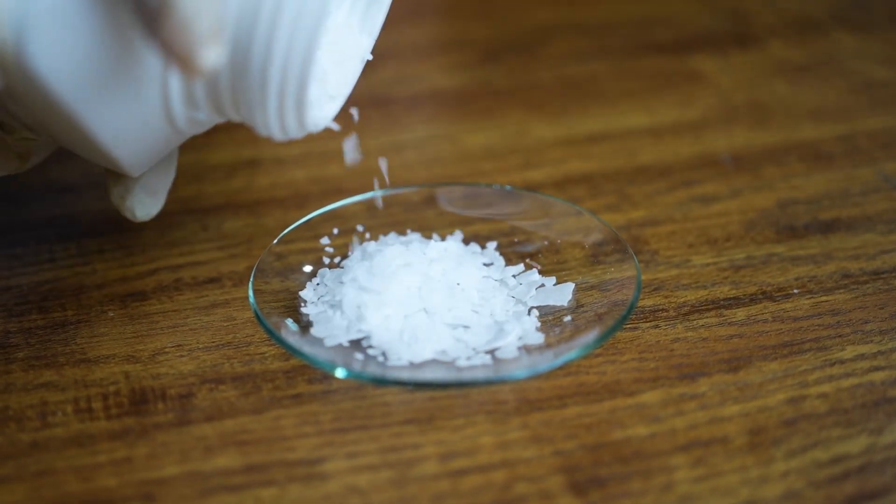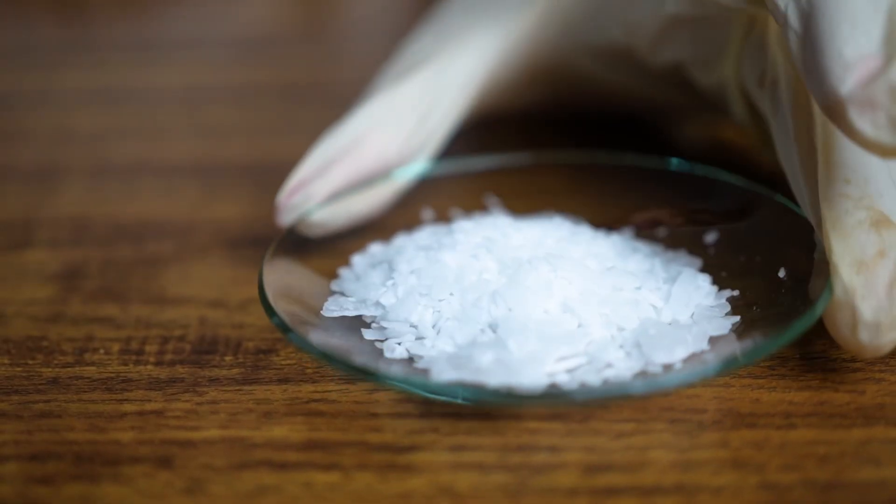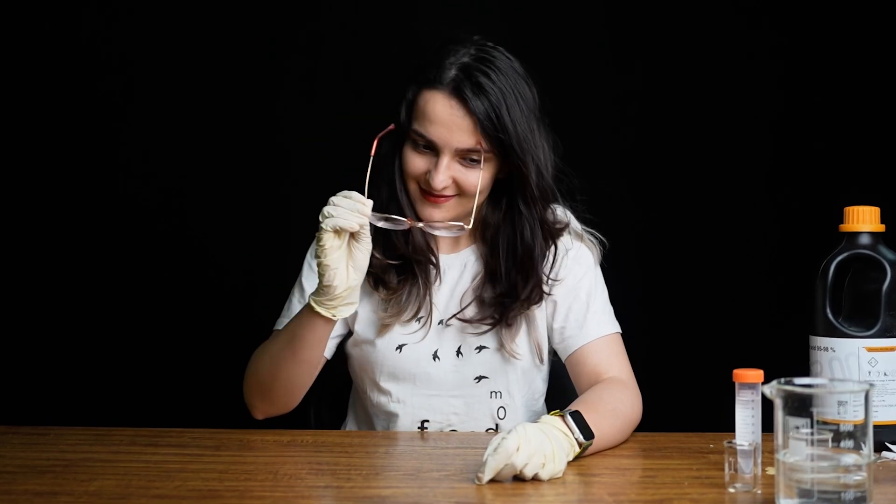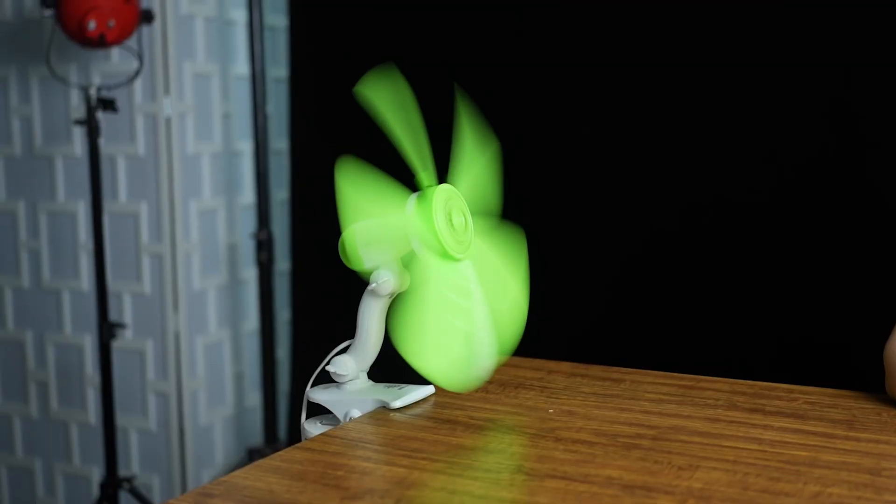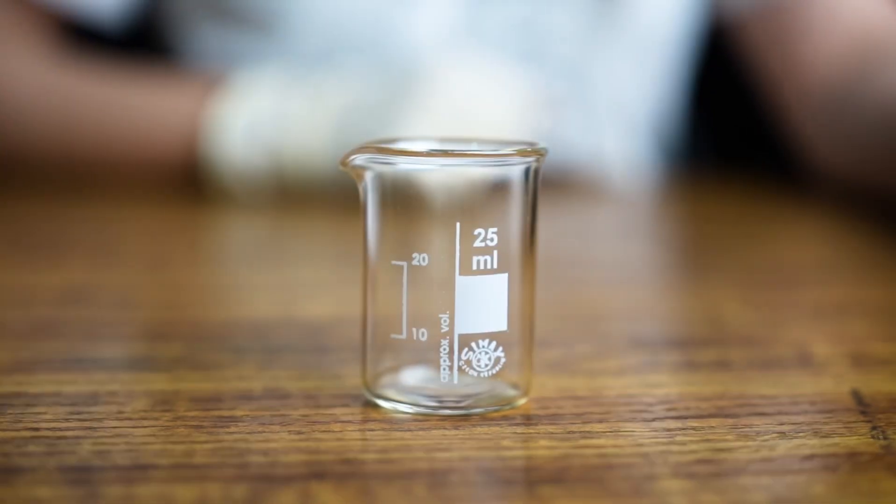So this time I'll try my best to wear gloves and at least turn on my chemical hood. Oh wait a minute, I don't have one but instead I could use a fan. It pretty much does the same job.